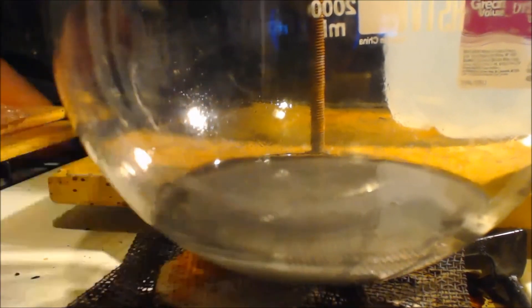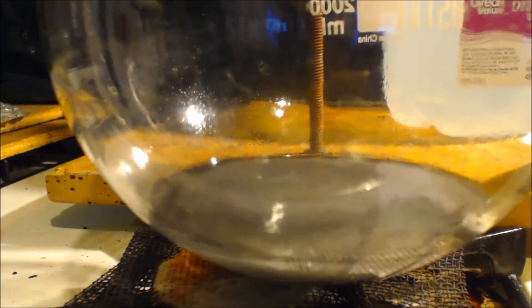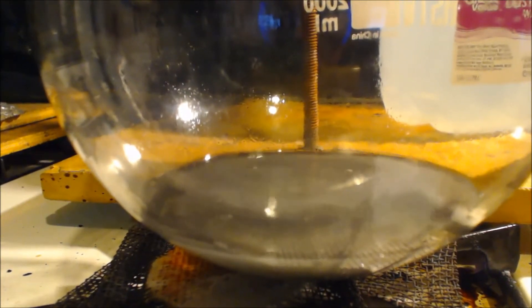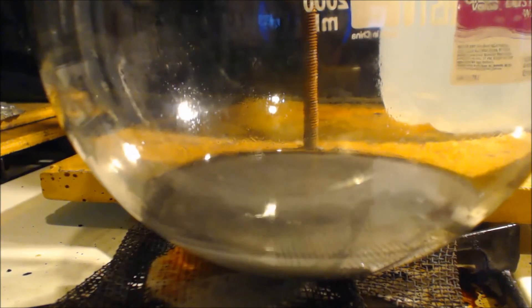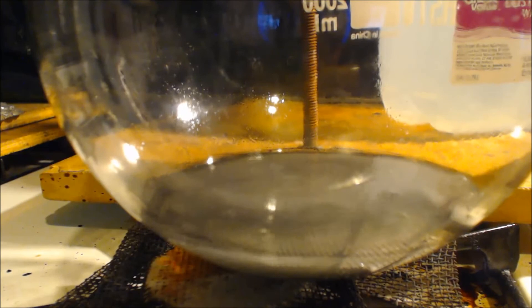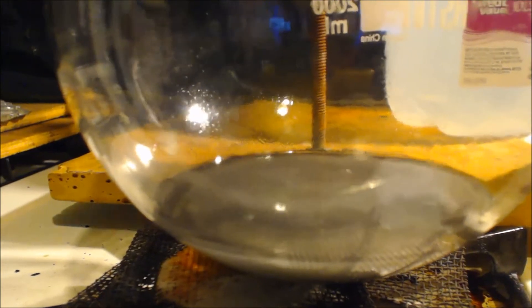This is not heated up really. It's heated up 10 degrees. And five of that was just because I added the sulfuric acid to the water. And then later I added more water to the sulfuric acid. And that heat, you know, that's exothermic. Usually when you do something like this, it heats up. Anyways, I'm still dripping it in. Because I added that 200 milliliters of water, it's taking even longer. It keeps bubbling. Still wasn't that hot. It's about 30 degrees. Started out at 18. I'm just going to take a break from this for a while.